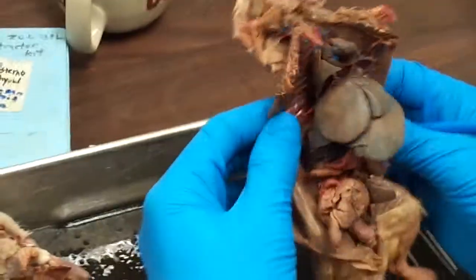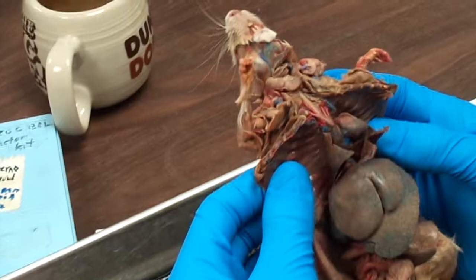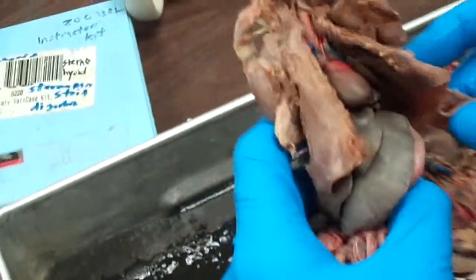You guys have any questions? You want to see anything again? Can you show the one in the female? The ovarian. Ovarian. Yeah.